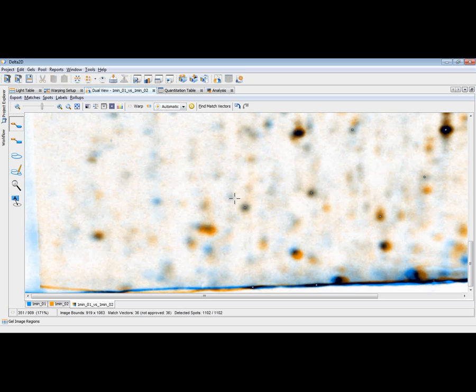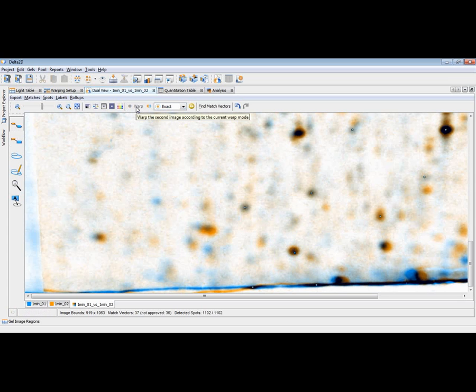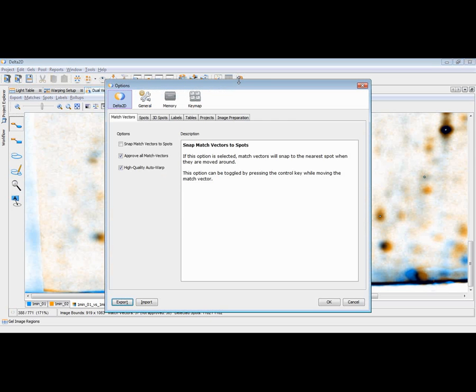Also, this can happen. And instead of applying automatic warping again, we can add match vectors manually, for example, by clicking on a certain position on an orange spot and then on a respective blue spot and press warp to apply this match vector. Defining match vectors can be easy if you use a snap to spot feature. Then the end of match vectors will be automatically snapped into the next existing spot maximum. We can activate this in the options. There is this parameter snap match vectors to spots.